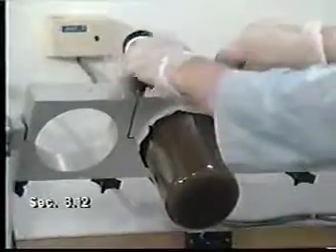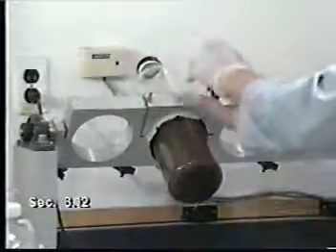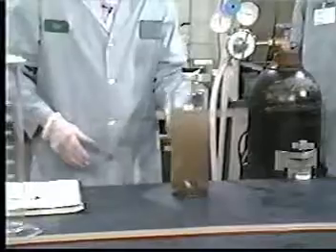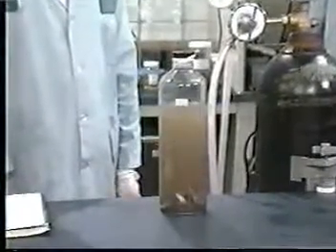When the agitation period is complete, remove the bottle from the extractor. Allow the contents to settle, as they will have to undergo a final filtration. This filtration is conducted exactly as before, but with a new filter. At this point in the procedure, since the object is to recover the liquid in the filtration device, but not the solids, it is allowable to replace a clogged filter with a new one. Acid washing the filter is again required if metallic contaminants are of concern.